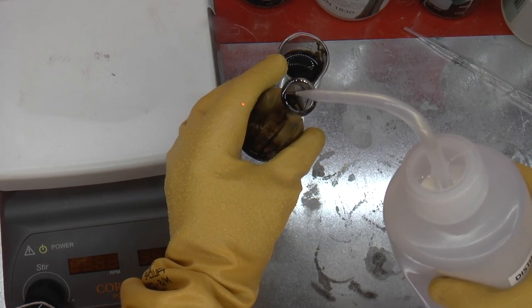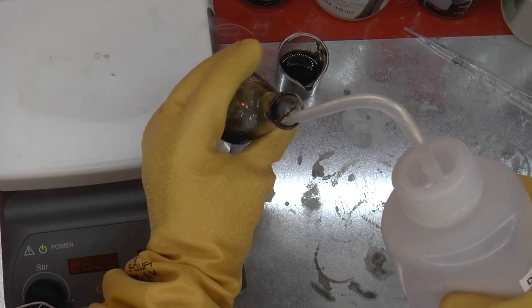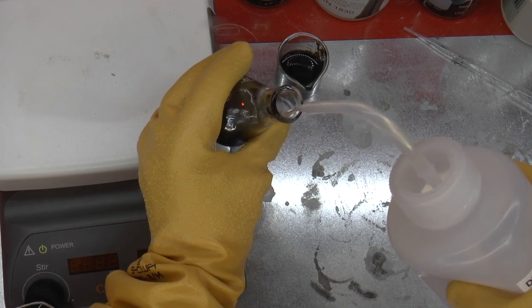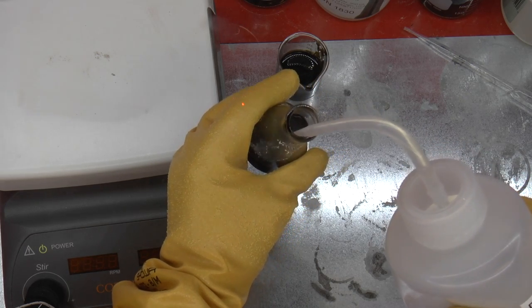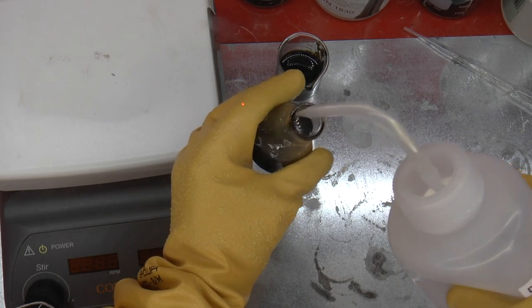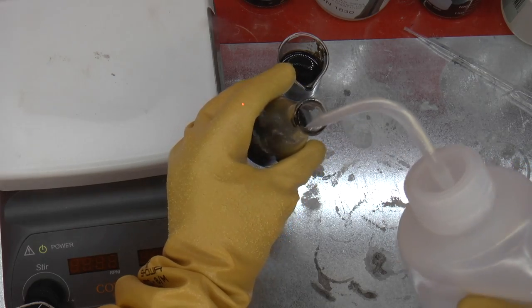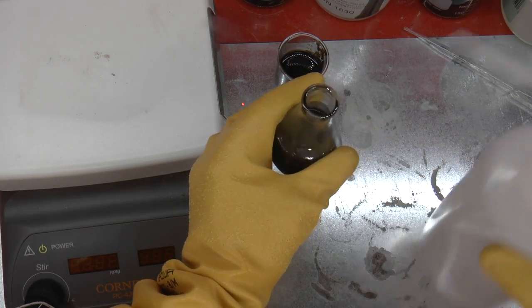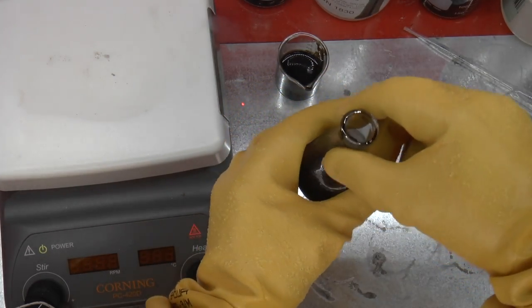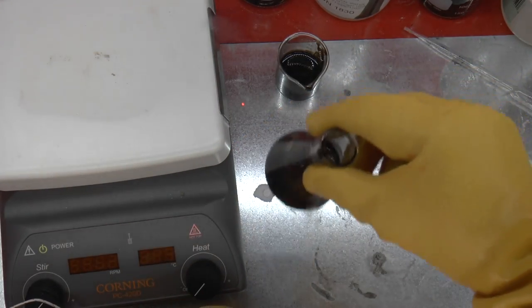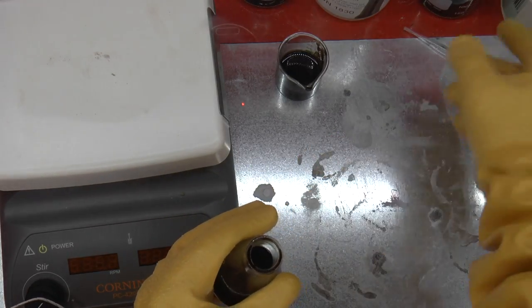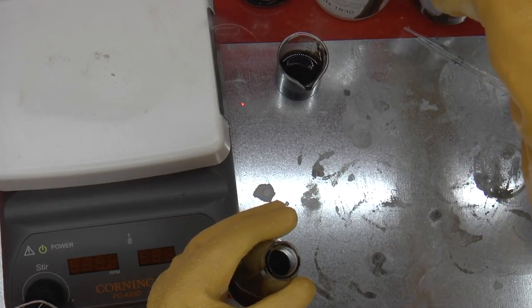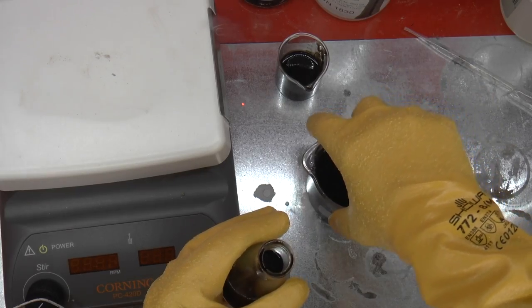I'm just going to take some distilled water and pour it in. They say that you should never add water to acid, but of course I'm adding water to excess, so there really isn't any risk of a runaway reaction here. I'm basically filling it halfway or so and swirling it around, maybe cleaning the sides.